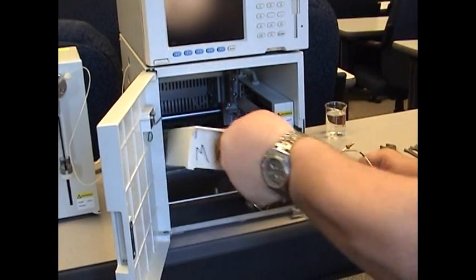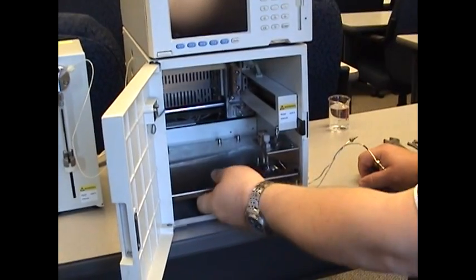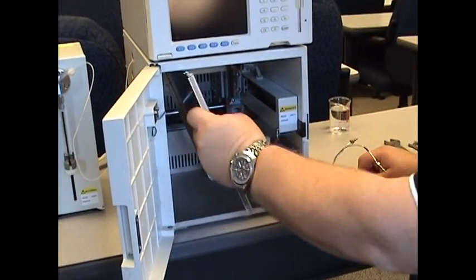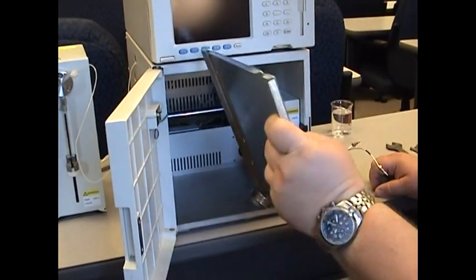Next, remove the sample tray. The sample tray holder simply lifts up and out.